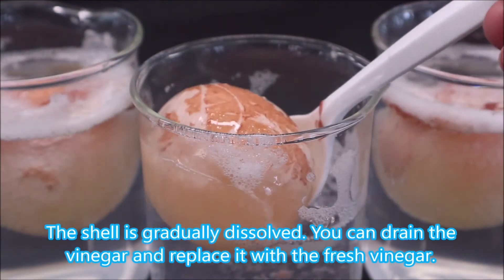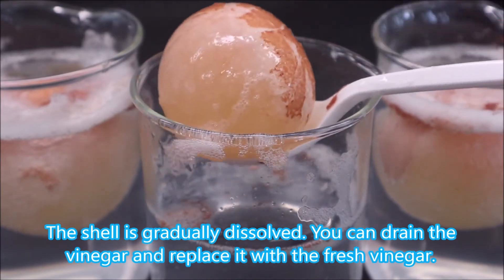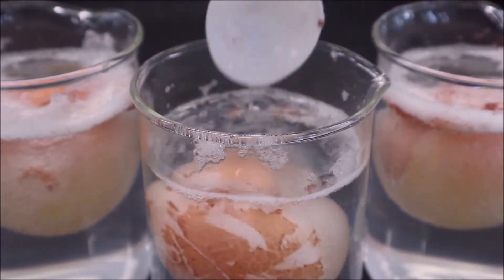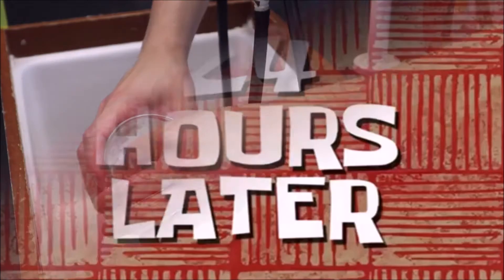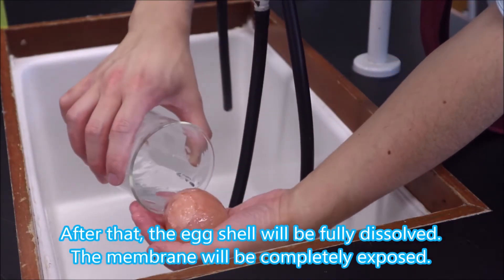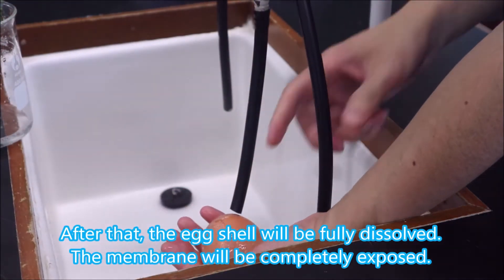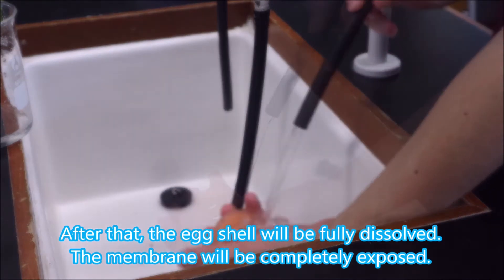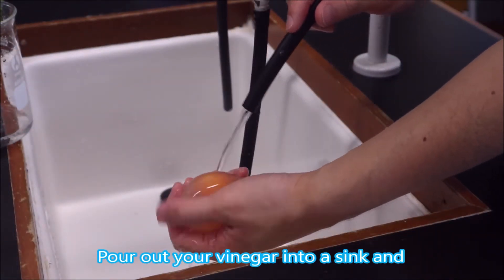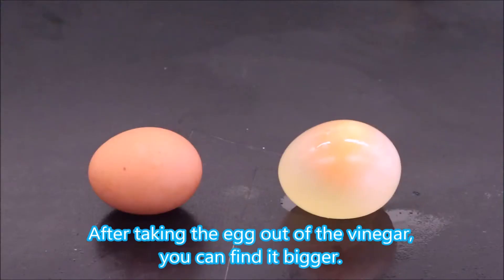The eggshell is gradually dissolved. You can drain the vinegar and replace it with fresh vinegar. After that, the eggshell will be fully dissolved and the differentially permeable membrane will be completely exposed. Once this step is complete, pour out your vinegar into a sink and gently catch the egg and rinse it.